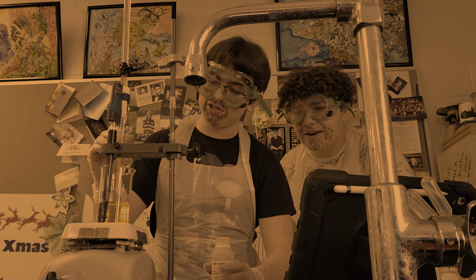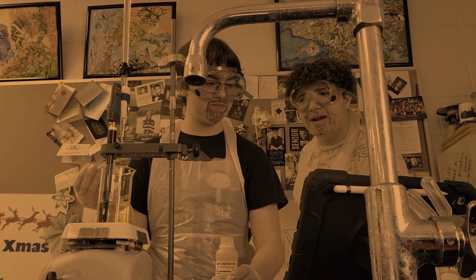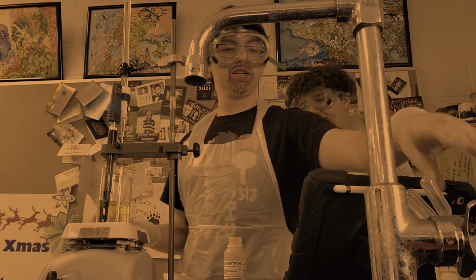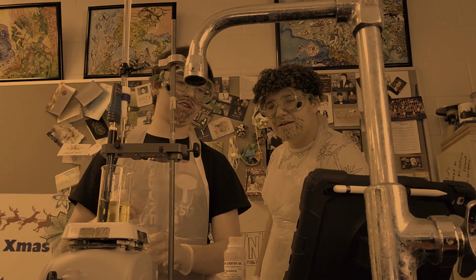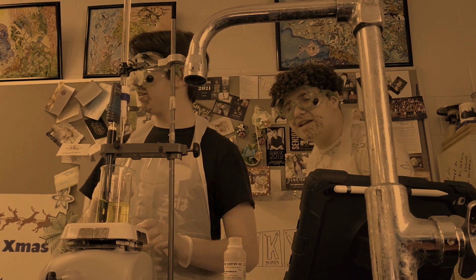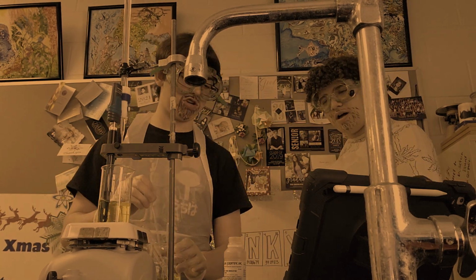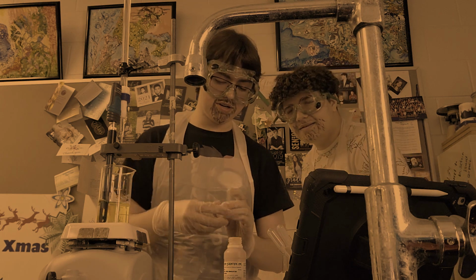That's a lot of indicator, Mr. White. You know I love science. Do you love to cook, Mr. White? Not as much as I love science. It's like a yellow color. It is. So what do you think it'll do whenever it's finished? I think it'll turn into a bit of a red-orange. Wow. That's what we're hypothesizing here.